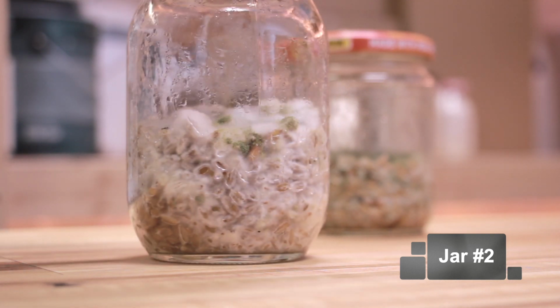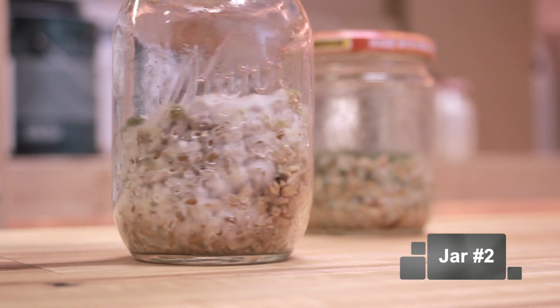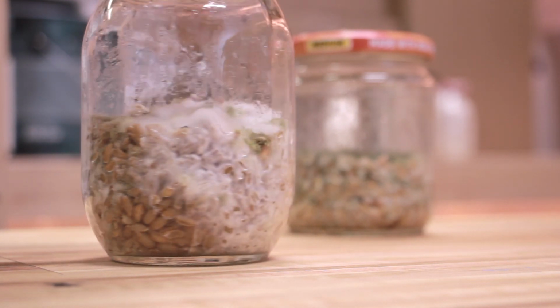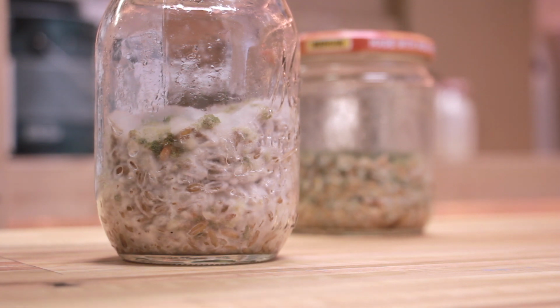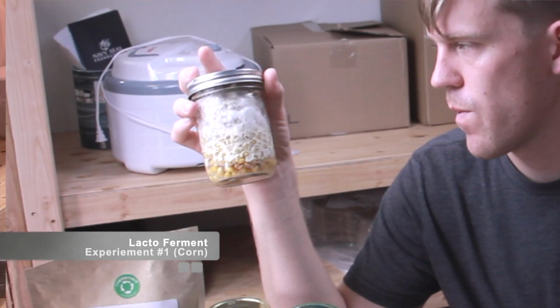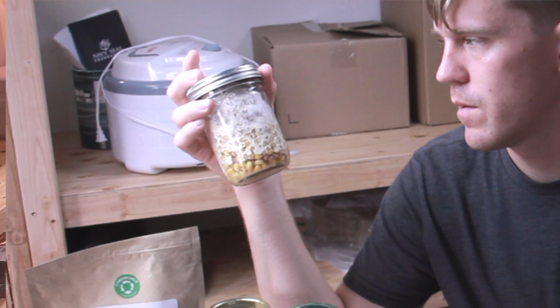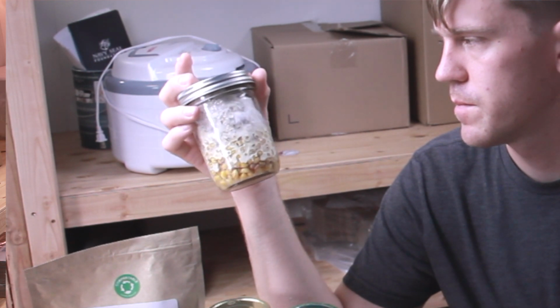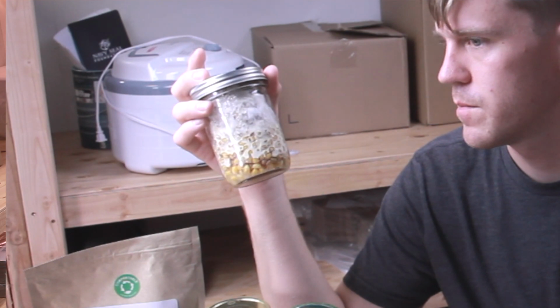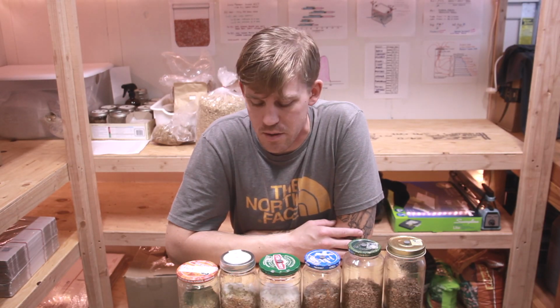In the past, when I did the first experiment with lacto fermentation, I used corn, but I didn't dry it very well, and it ended up being really wet in the bottom of the jar. And you can see that here, how the jar got a good half inch of liquid at the bottom, which just caused it to ferment more. It wasn't able to colonize in the bottom, so that one came out pretty rough.